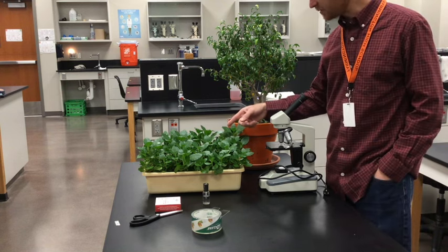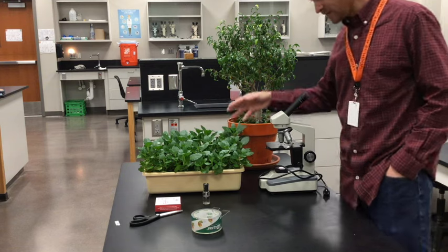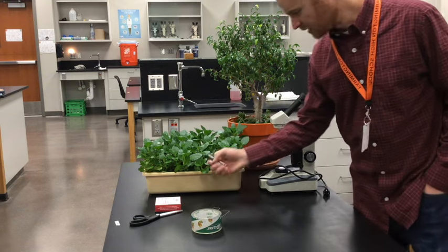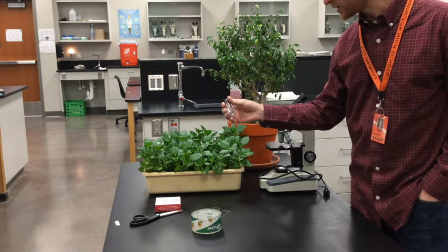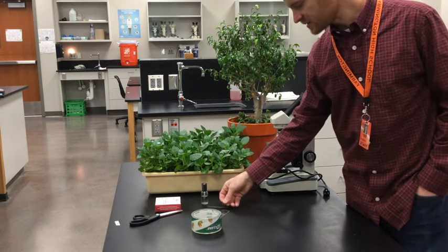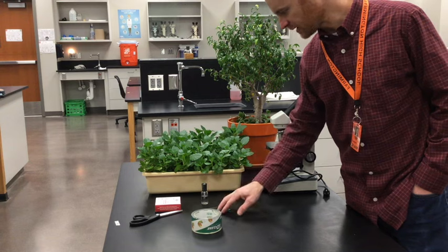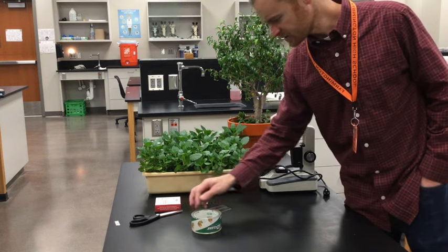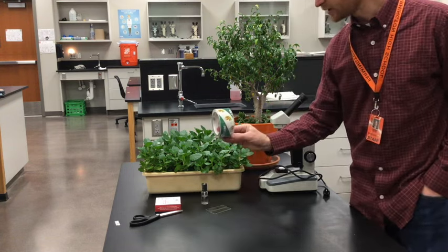It's kind of a funny name, it's actually called Flaming Katie. You'll need some clear or transparent nail polish, a few slides, you won't need cover slips, just slides, scissors and clear tape.